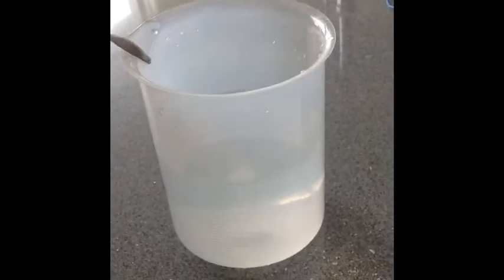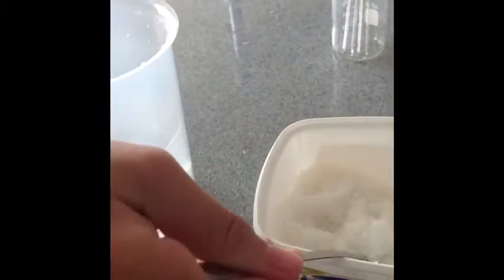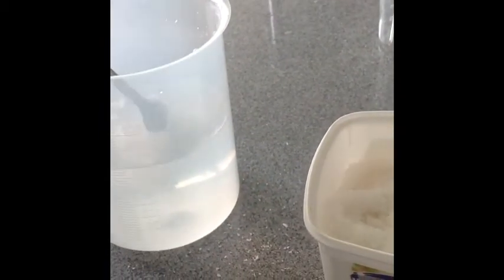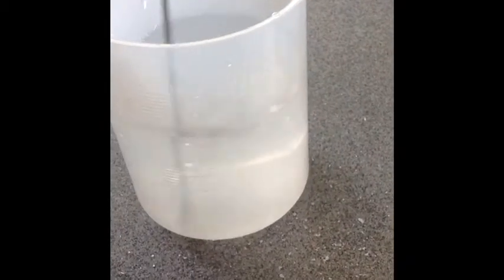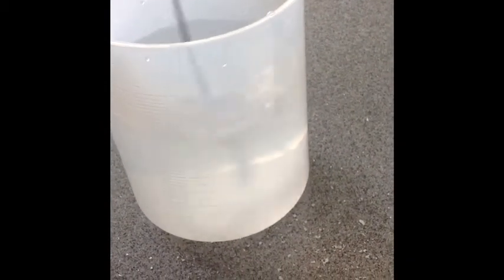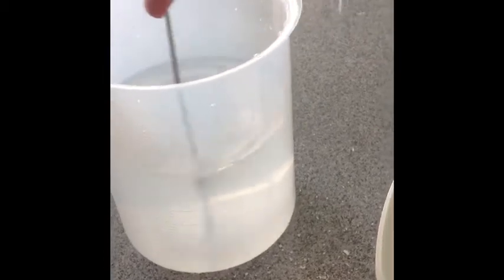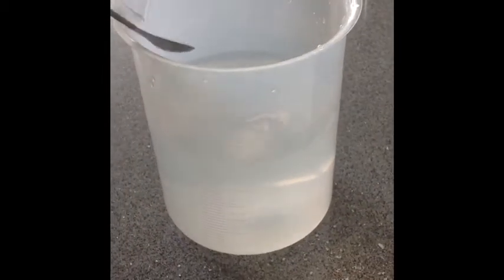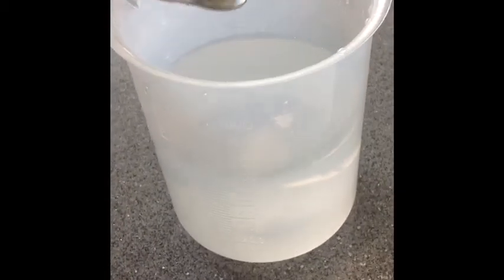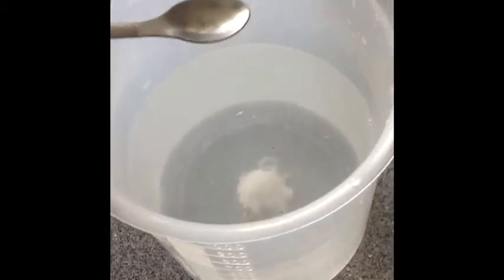To start, we're going to add salt into the beaker of water until the salt can't be dissolved anymore. We've already added some salt into it, so if you're doing the experiment, you have to add a little more.